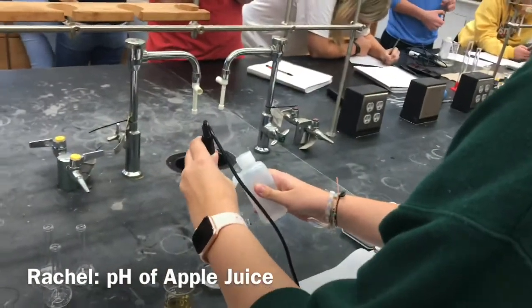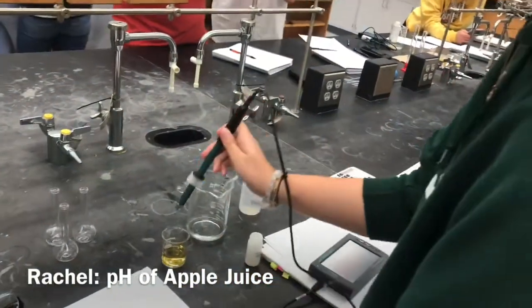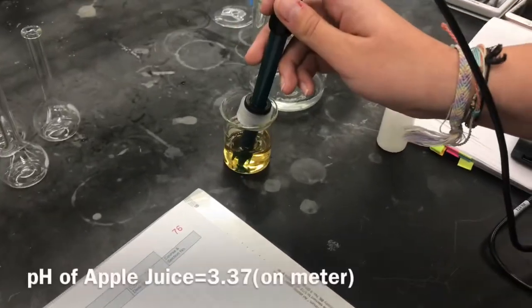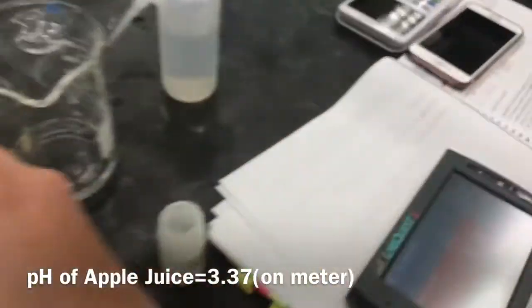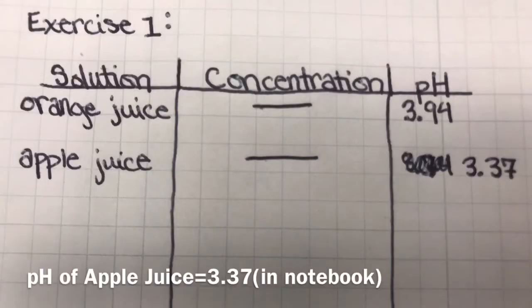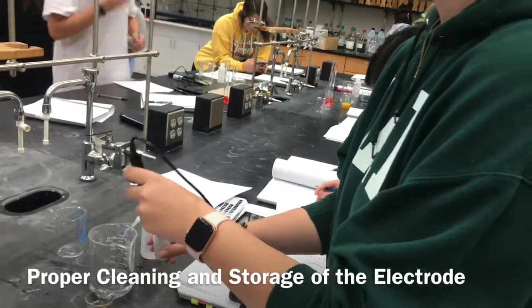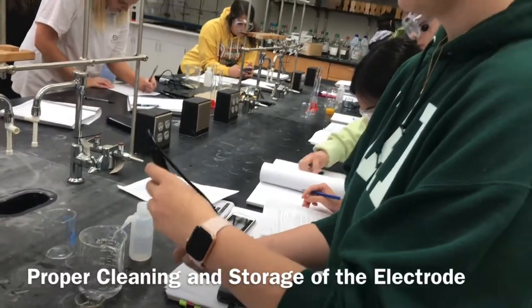Next, we use the pH meter to determine the pH of apple juice by rinsing the electrode and then immersing it in the apple juice. We wait for the pH to steady out, and then we record the value in our notebook. We then properly rinse and store the electrode for later use.